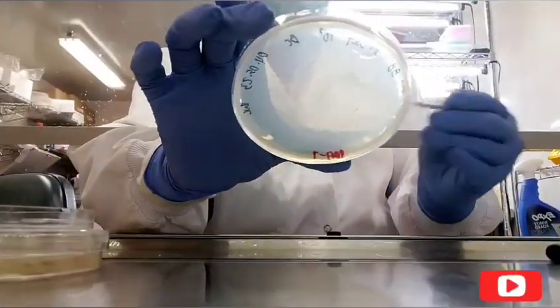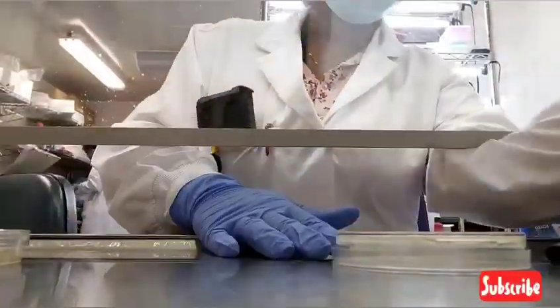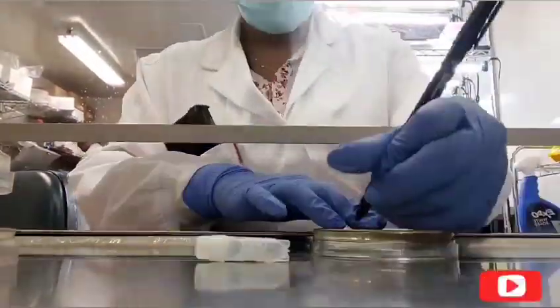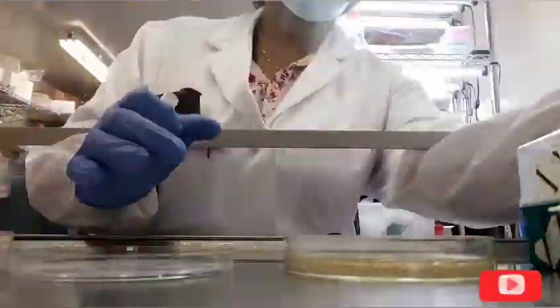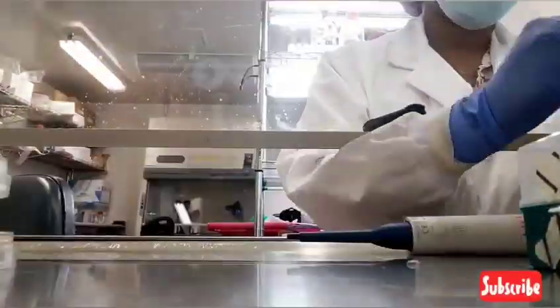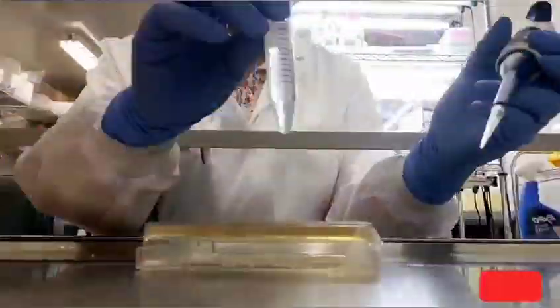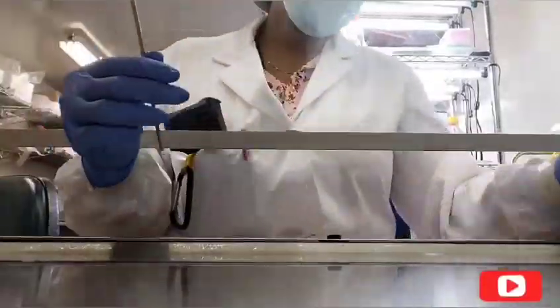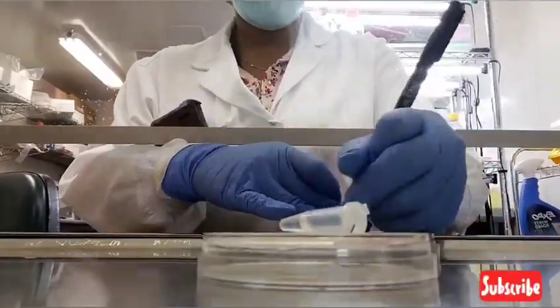And some of the fungus, they're already in liquid form. So in those cases, I'll pipette. That is putting on the tip, taking some up, and then dripping that liquid onto the plate. First, the liquid isolate, so the isolate spores that are in liquid form, they're not agar plug. I am using that metal loop to streak it, so essentially to spread it across the plate because it's in a liquid form.